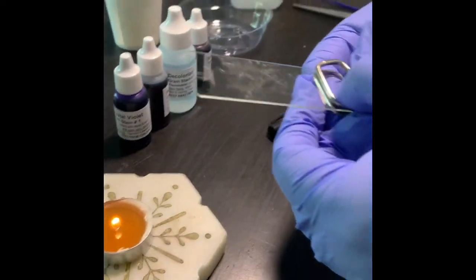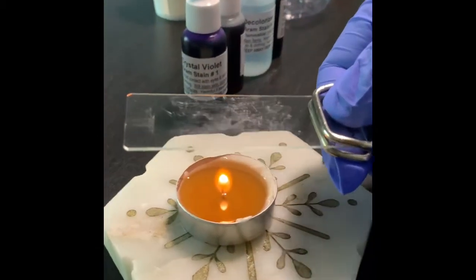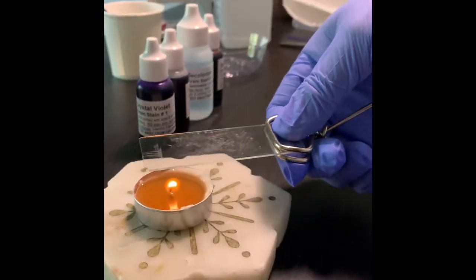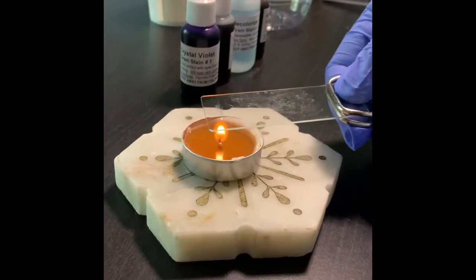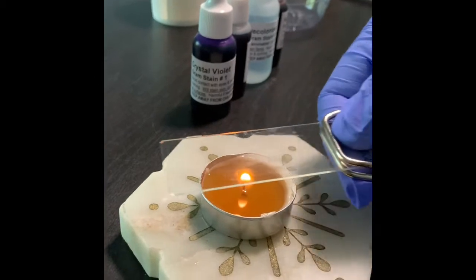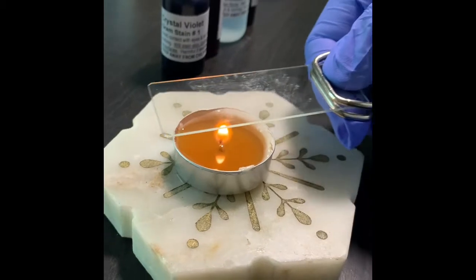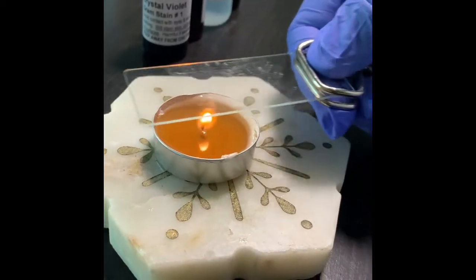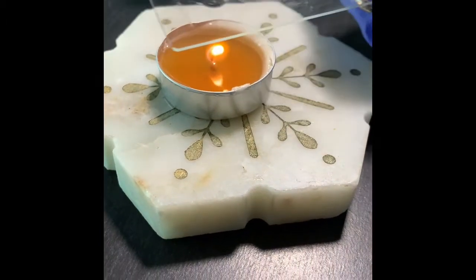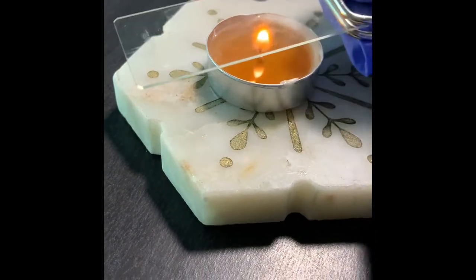My writing is at the top, and from the back of the slide I'm putting on the flame, not very near, not very far, and I will move on to fix the bacterial cells to the glass of the slide. If I don't use the heat for the fixation, then the bacterial cells will wash off. They will wash off with all the stain and alcohol I'll be using in the gram stain.